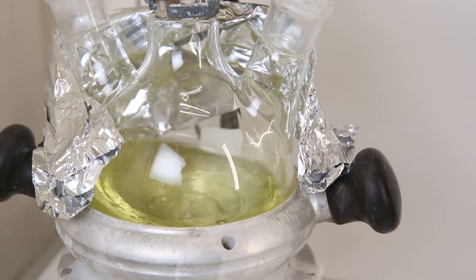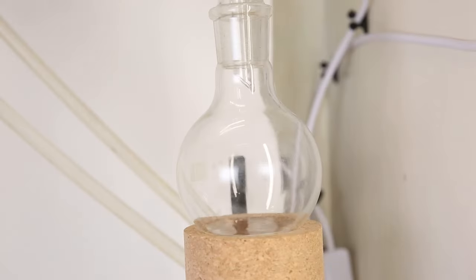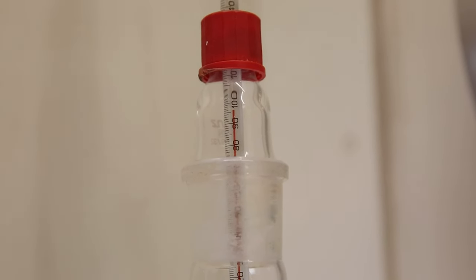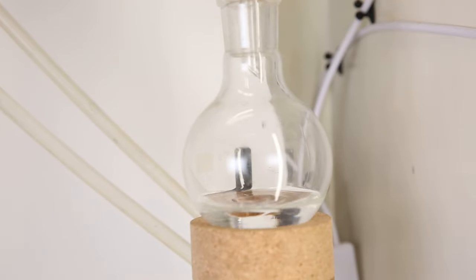I increased the temperature again, and this time the temperature stabilized a little below 90°C. 90°C should correspond with isoheptane, which is a relatively minor part of the fuel. Very quickly the temperature already started increasing to around 96°C. The compound with a close boiling point to 96°C is heptane, which has a boiling point of 98°C, which is the same for 2-heptene.